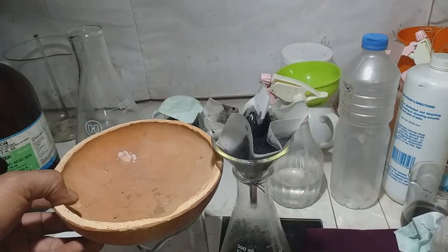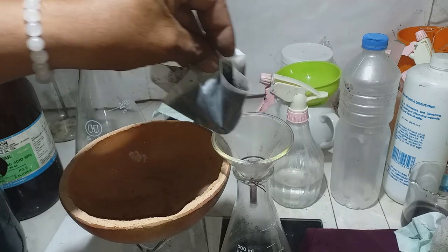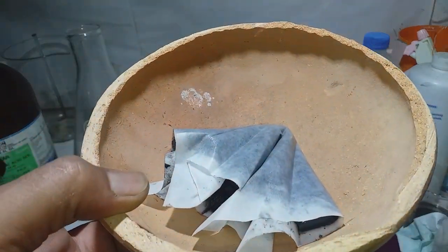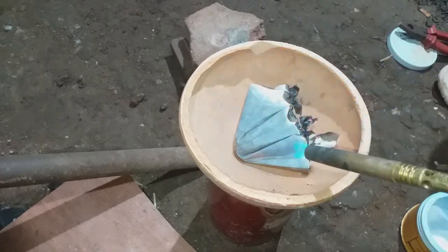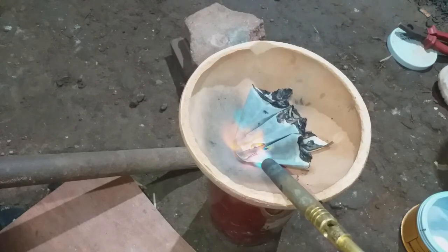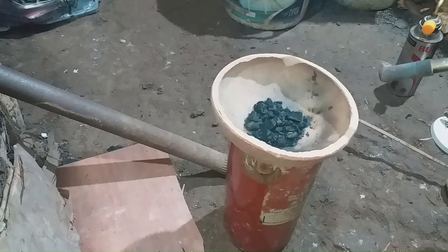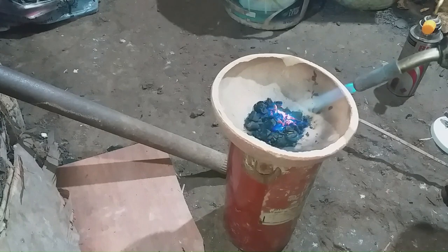We are adding our captured powder into our DIY melting setup. Let's go — we dry first, then change our torch to warm up the material. Let's see what happens.